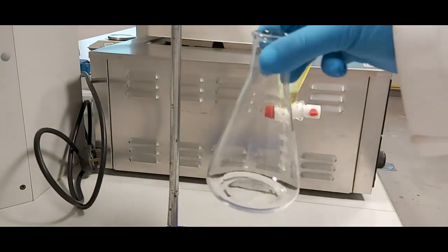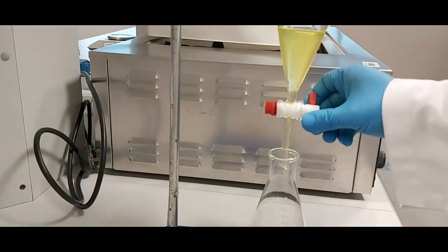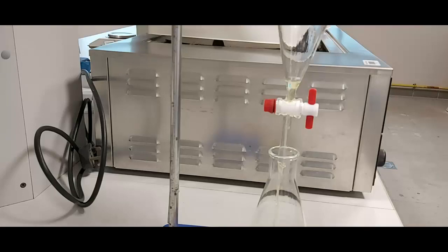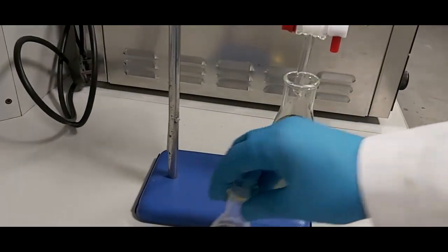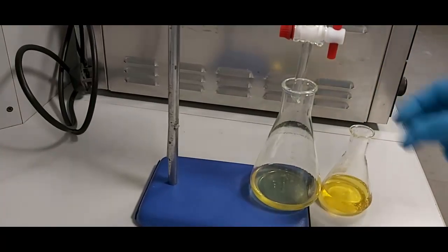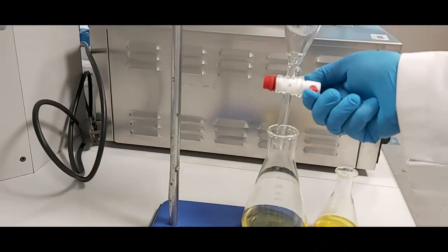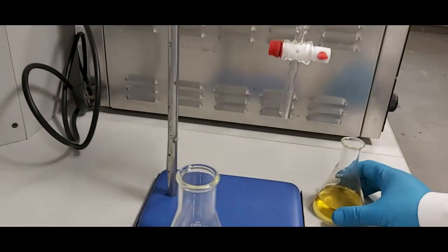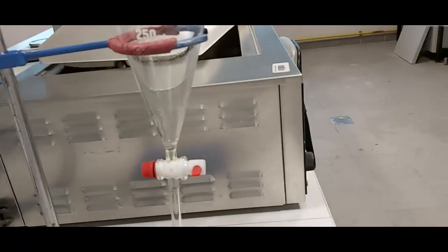I take the ether phase and collect all of it. Here I have the water layer and the ether phase separately. I will wash the water again with another 20 ml of ether, adding the water back into the separatory funnel for the second extraction.